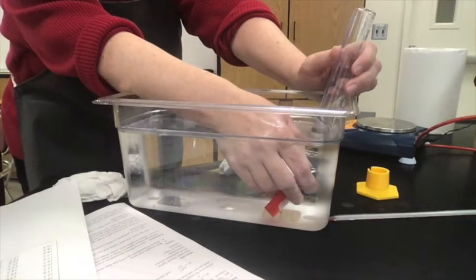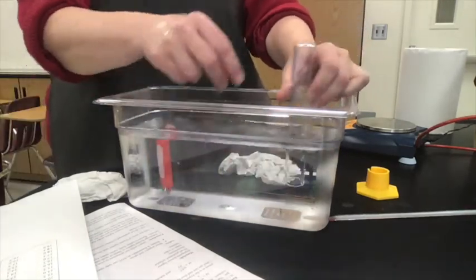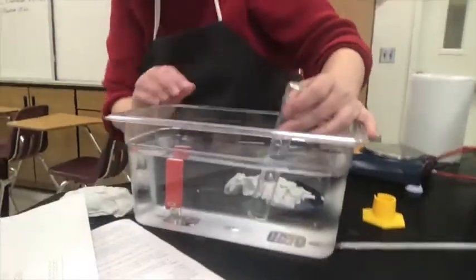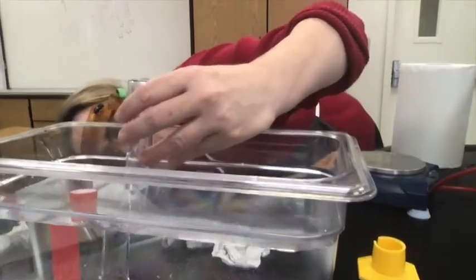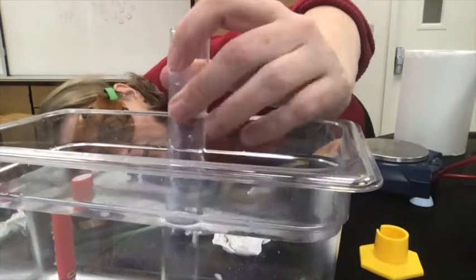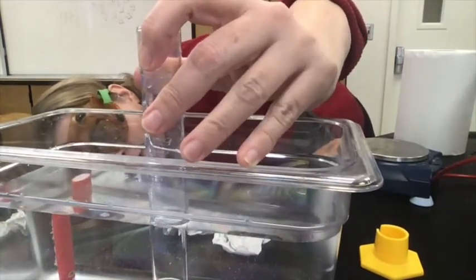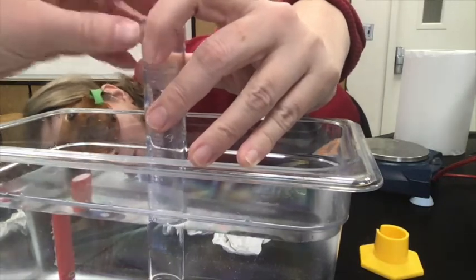All right, so we kind of paused and fast forwarded here, so you didn't have to watch us filling the entire graduated cylinder. But now we have it filled to approximately 45 milliliters. Now, are they going to be able to read this on here? So it's always a little bit hard to read against that level. Can you see it, Miss Frankovic, or do I need to pull it on over? It's tilted a little bit.